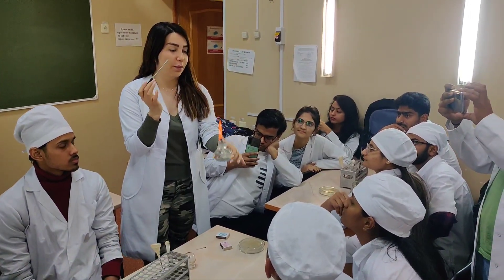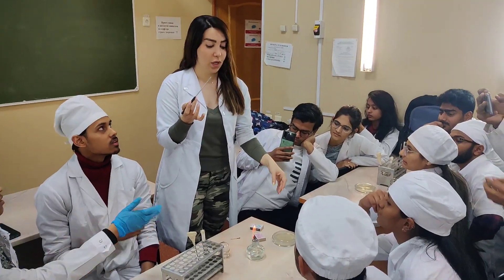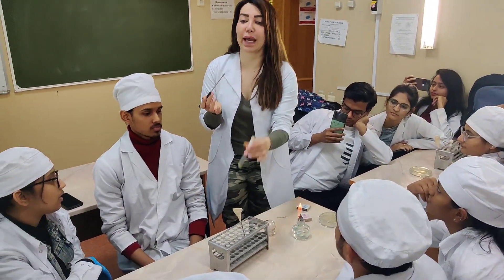After that, you will be waiting some minutes. Why? Because you don't want to kill the bacteria.